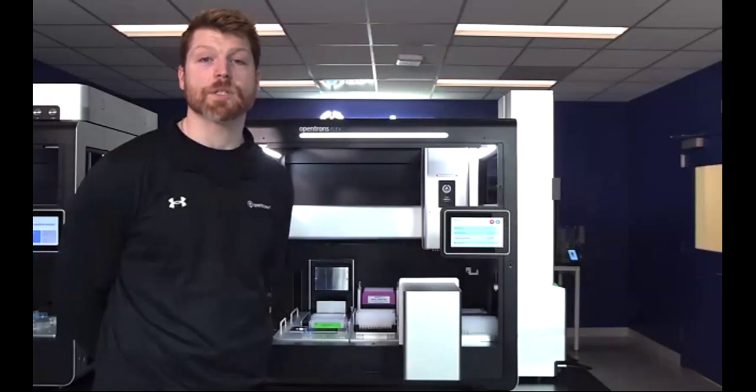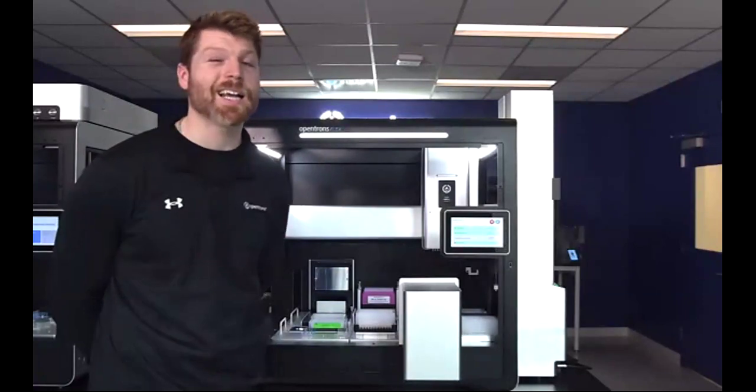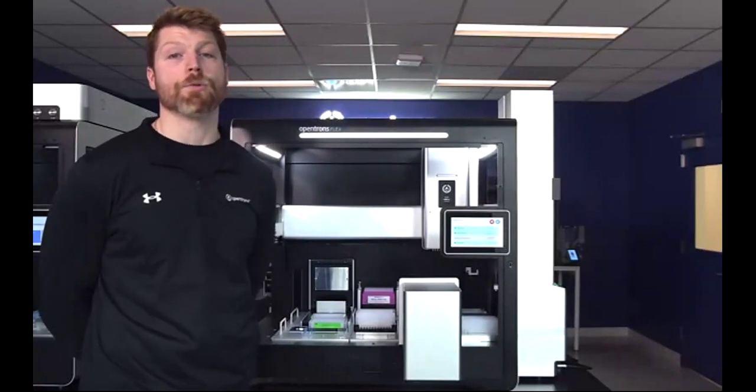And then finally, we also have our on-deck display touchscreen, which allows you to easily store, pull up, and run protocols. It also guides you through any deck setups and automated calibrations, and allows you to change parameters on your protocol from run to run. We will walk through this in greater detail in a minute as we start this. But most importantly, the touchscreen provides a lot of prompts and a lot of guidance. It really does make the steps that you go through before the robot starts to run really straightforward and much more approachable for anyone in the lab to carry out, independent of whether they have a lot of information and experience with automation or OpenTrons products overall.